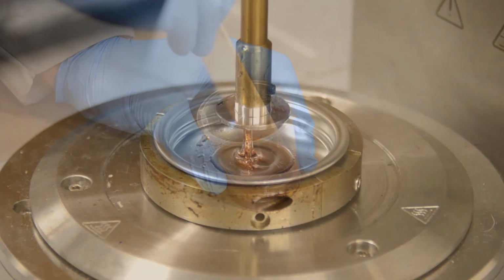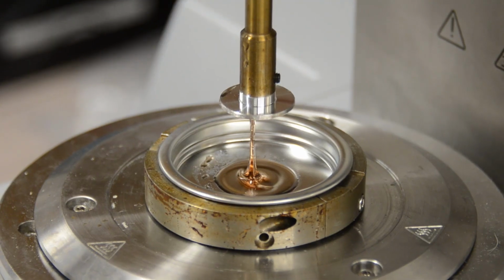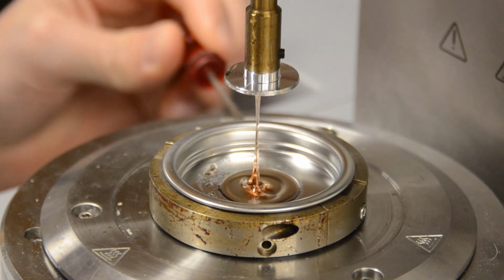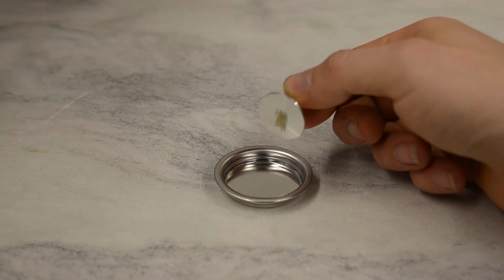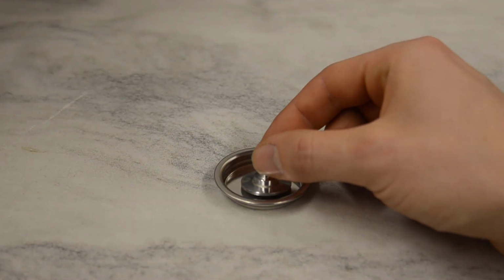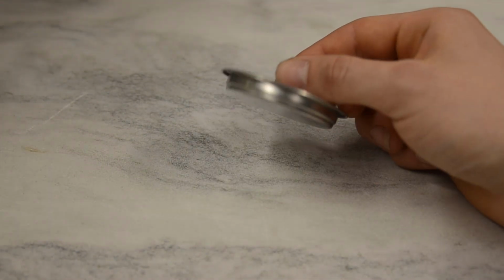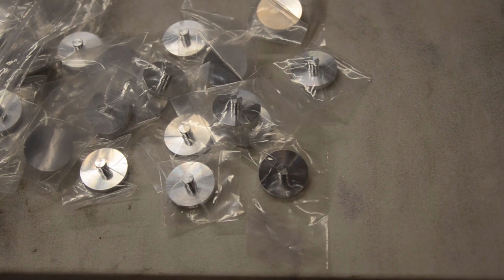A consideration especially important when processing resins is the ease with which measurement systems can be cleaned. The more complex the geometry is, the more difficult it may be to clean in between samples. Disposable, single-use carriers are also available for materials which may not be feasible to clean, such as resins which cure solid during the test. Simpler measurement geometries are typically less expensive, with parallel plate disposable systems being especially prevalent.